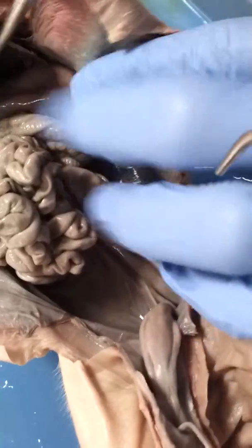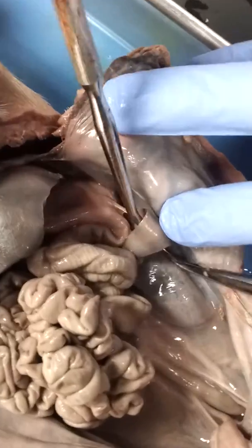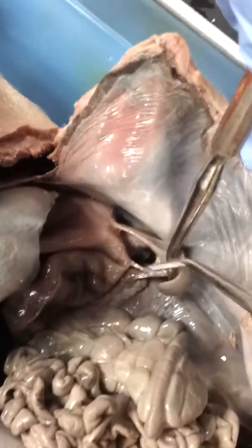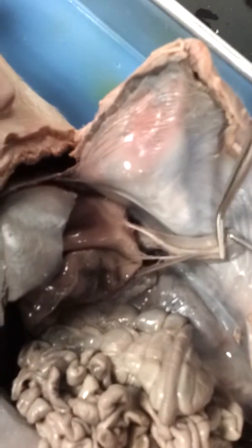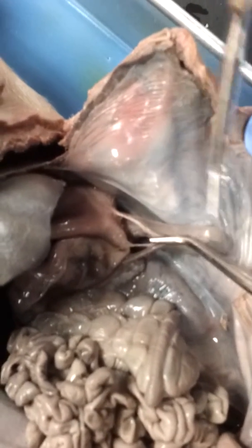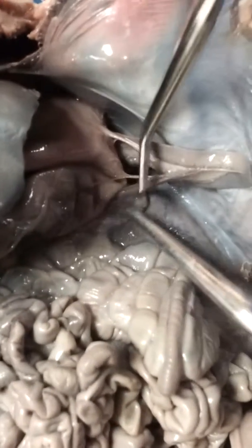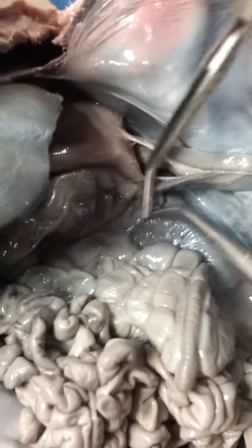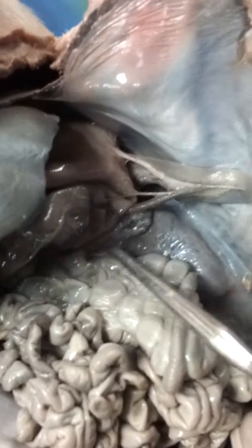And then the spleen, our last organ, spleen and pancreas. Now the spleen is right here. This is the spleen, it's thin and long. This thin, long structure helps in the purification of the blood. And then also this fish bone-like structure here, right here, is the pancreas. And this helps in the aid of sugars by way of insulin.